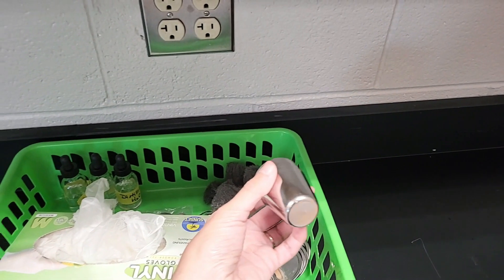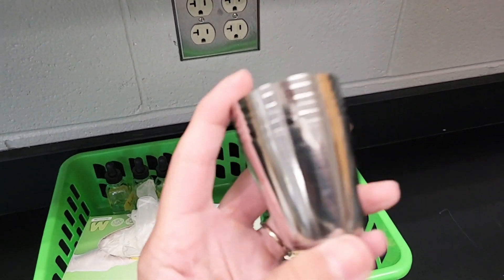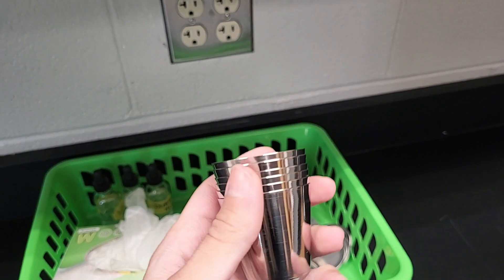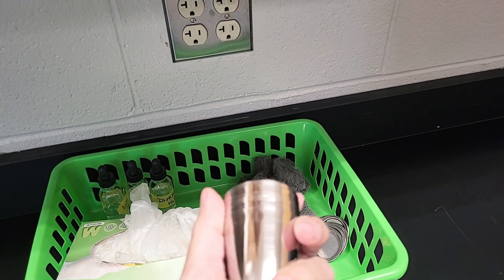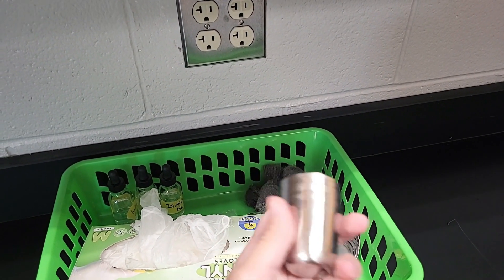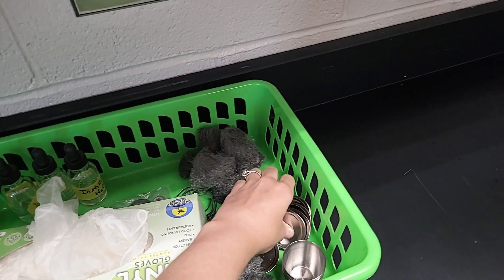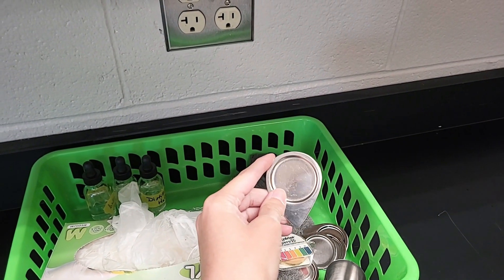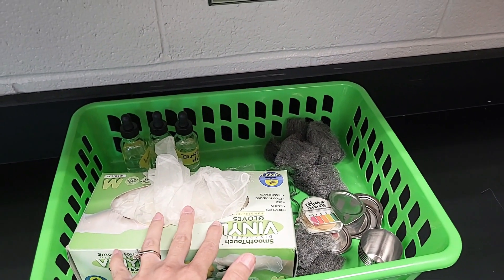What I'm going to have the kids do is prove that they formed a base by using some pH paper held over the crucible. I have brand new stainless steel crucibles — aren't they beautiful! I used to use porcelain crucibles but they always broke every single time I did this lab, so I started using these stainless steel crucibles and I absolutely love them. The magnesium ignites in no time, so it's a very easy lab.